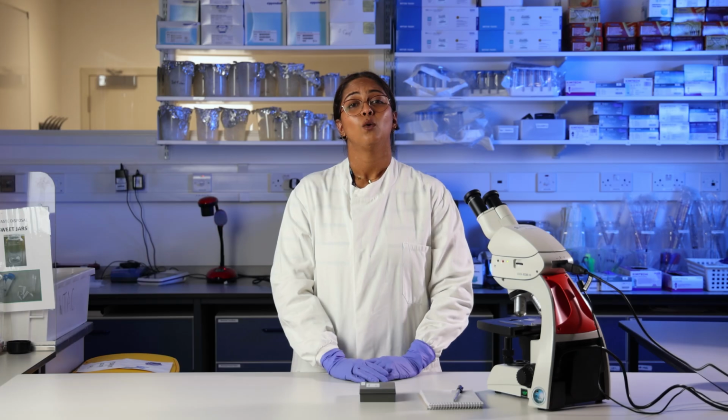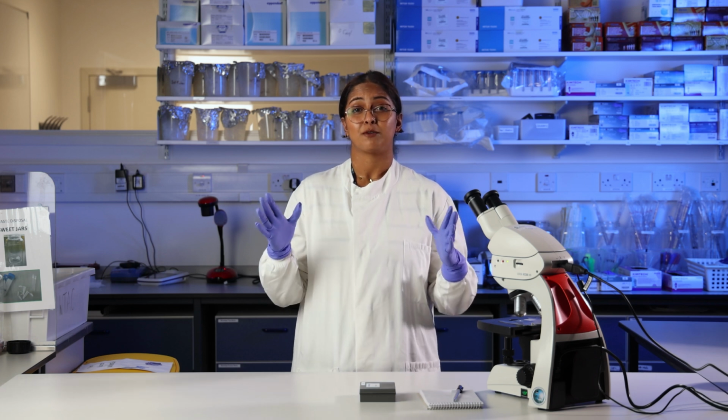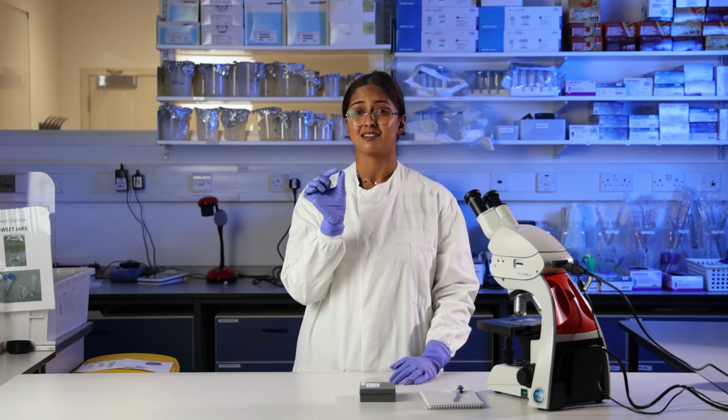If you've ever stared through a microscope and thought, what am I even looking at? Don't worry, you're definitely not alone. When you're used to looking at big objects like bugs, switching to tiny cells can feel overwhelming. And often, what you look at through a microscope has been stained funky colors, which could add to the confusion.